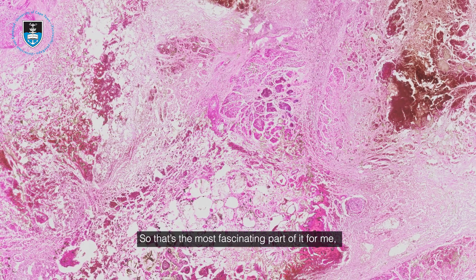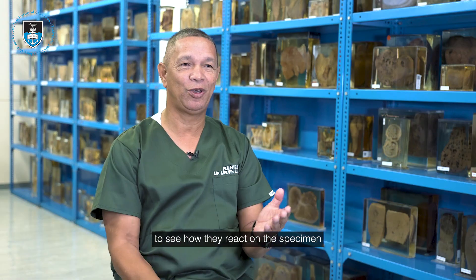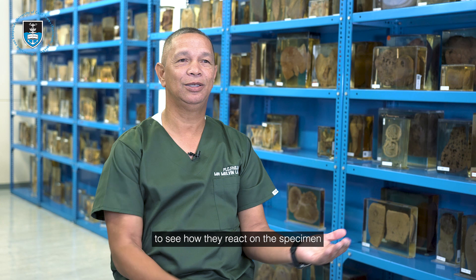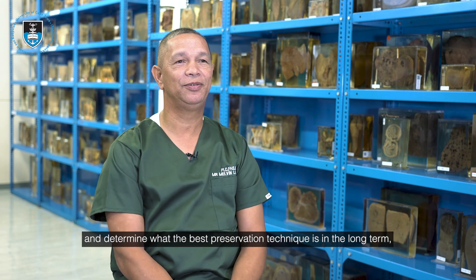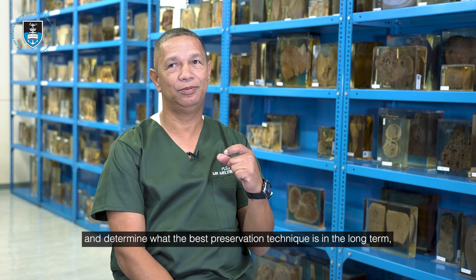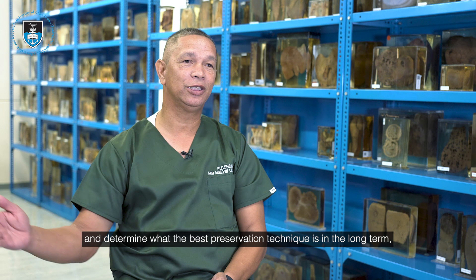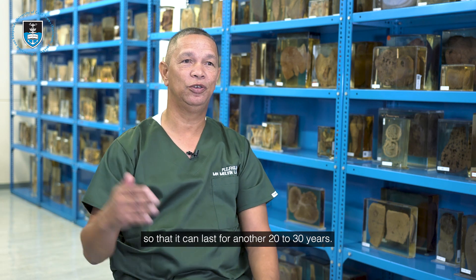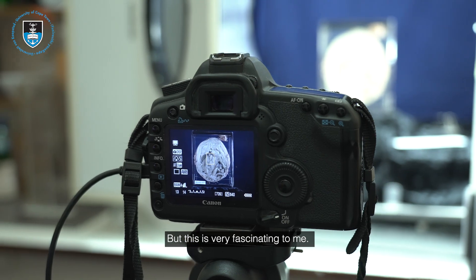This is maybe the most fascinating part — you can see how the tissue reacts to the preserving medium, and then you can decide what the right preservation method is for the long term. It can last from now for another 10 to 30 years. For me this is very fascinating.